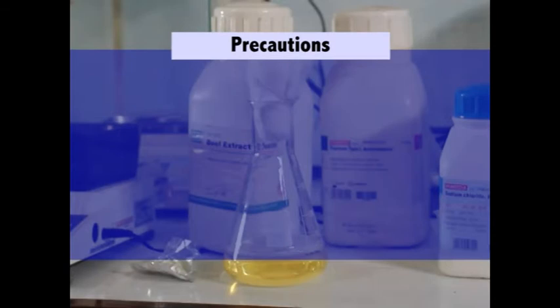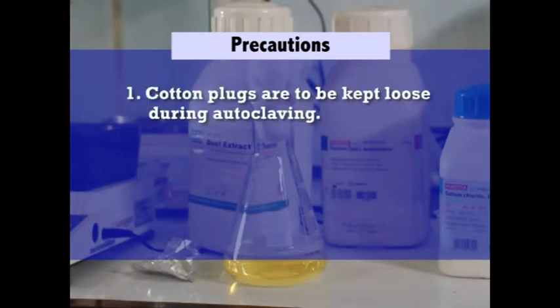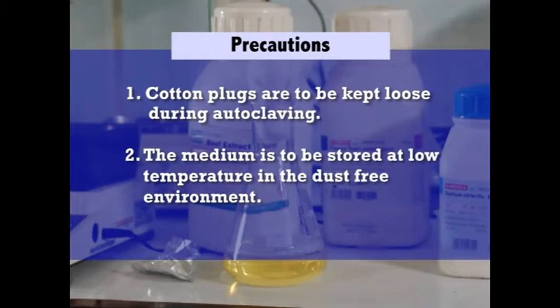In the precautions, cotton plugs are to be kept loose during autoclaving. Then the medium is to be stored at low temperature in a dust-free environment.